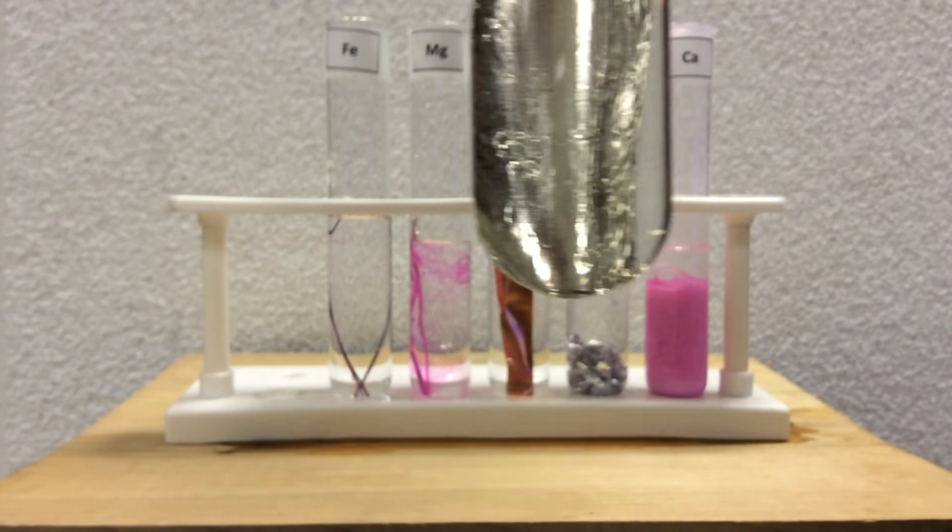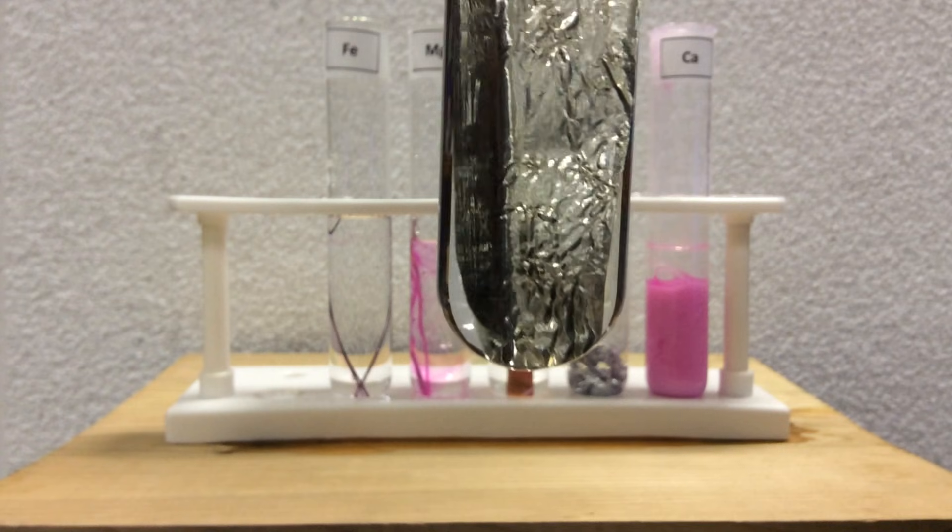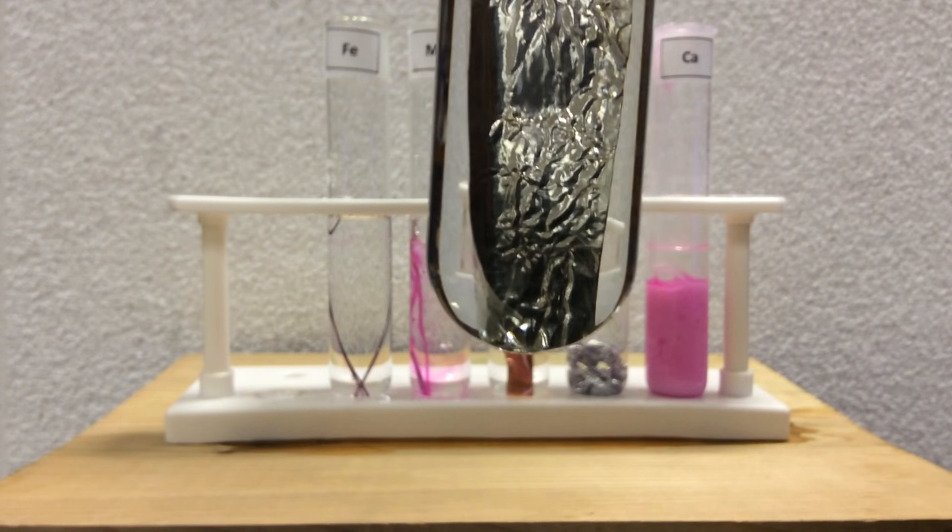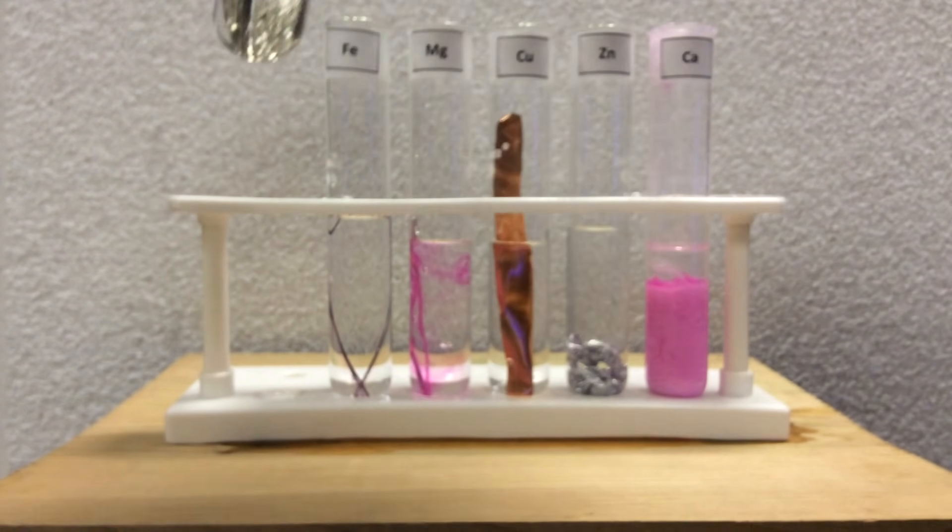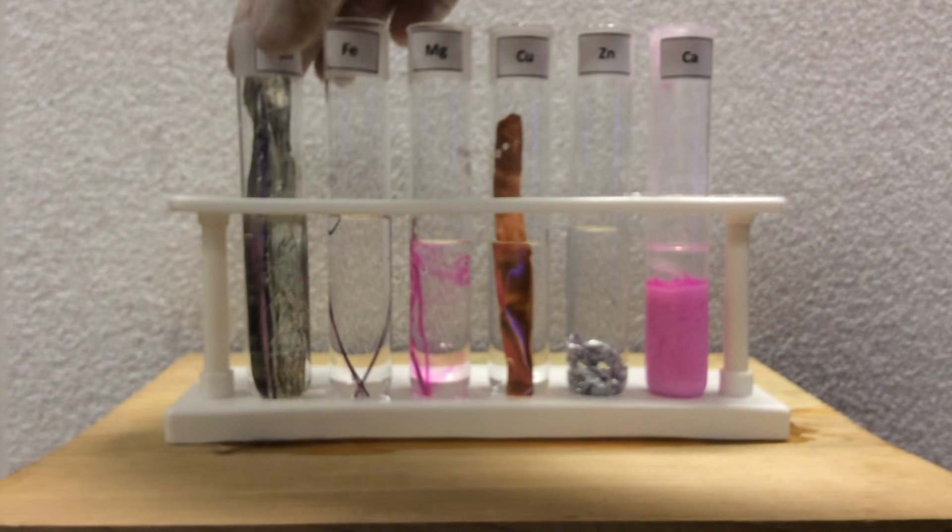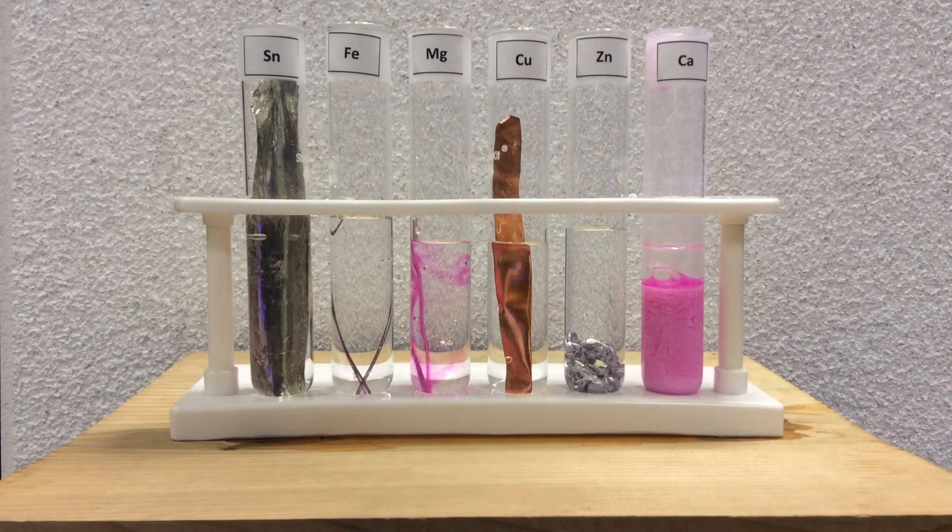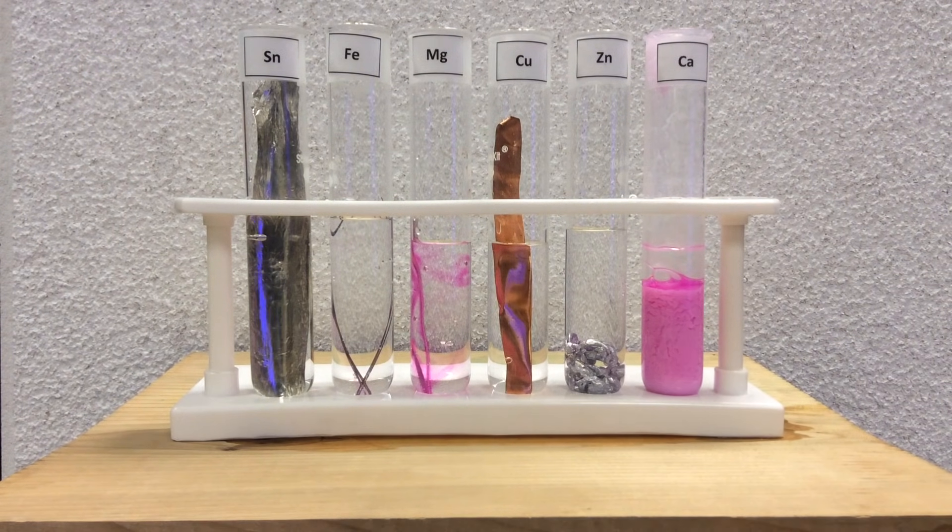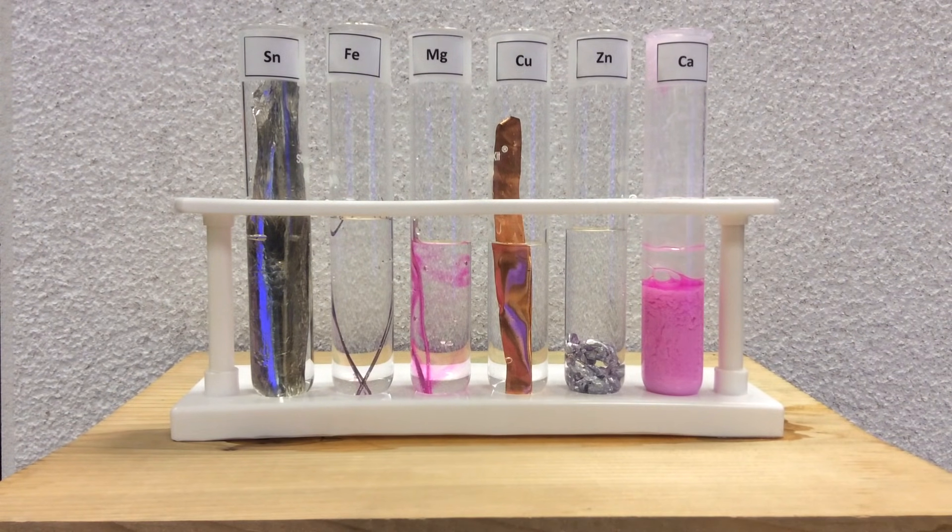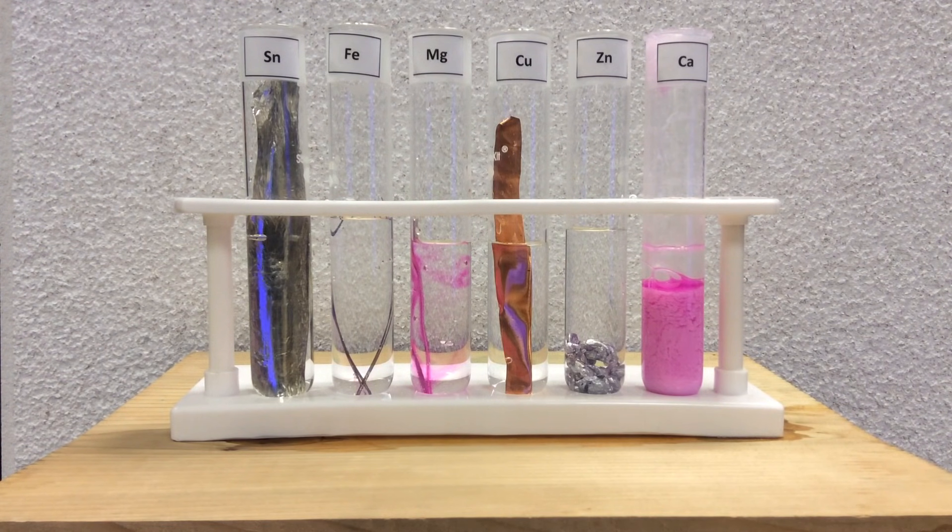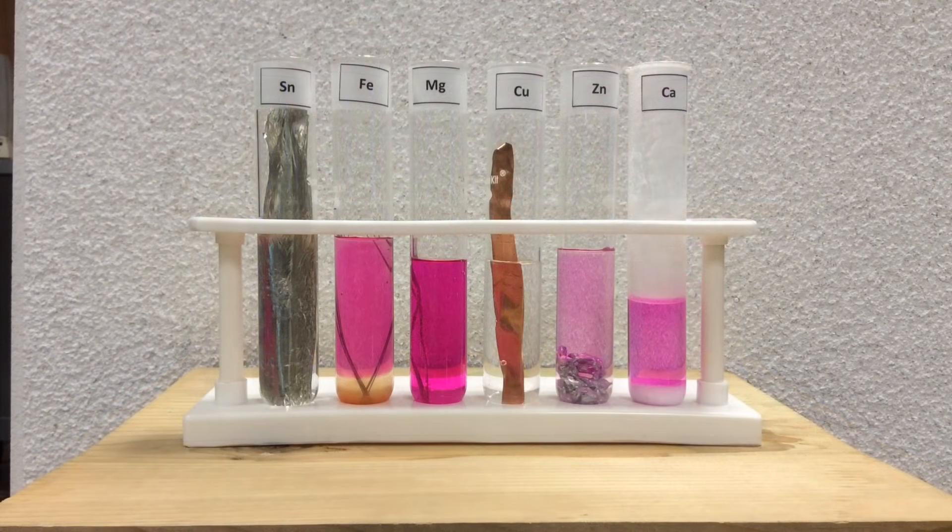And the tin, hard to find, but I don't see any visible bubbles for hydrogen gas, which is a product of the redox reaction as well, and no pink. So, what we're going to do here is let these sit for a day and come back and see if, in fact, that changes. Because, again, the rate of reaction is much slower in water.